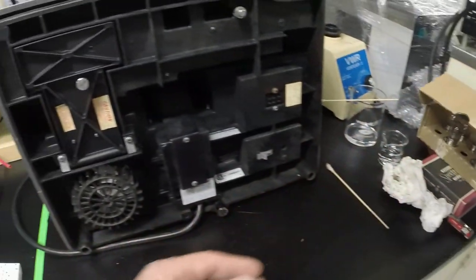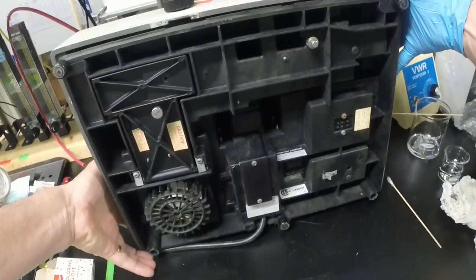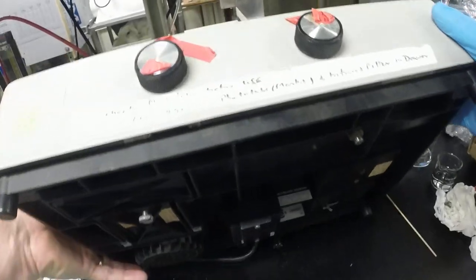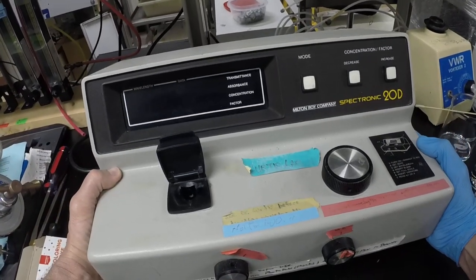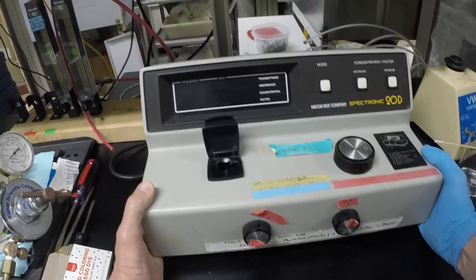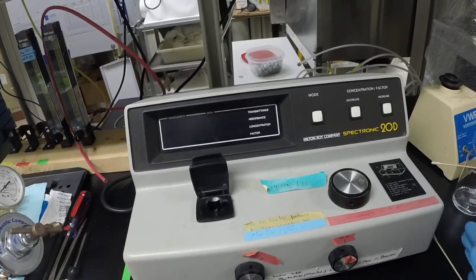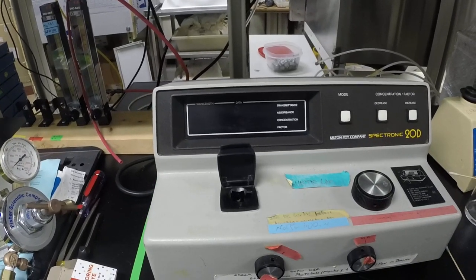So now the output on that should be way higher than it was on the previous one. And I'm going to go ahead and take the unit. These things are kind of built like a tank, which is a good thing. I'm going to pause for just a second while I go plug it back in.